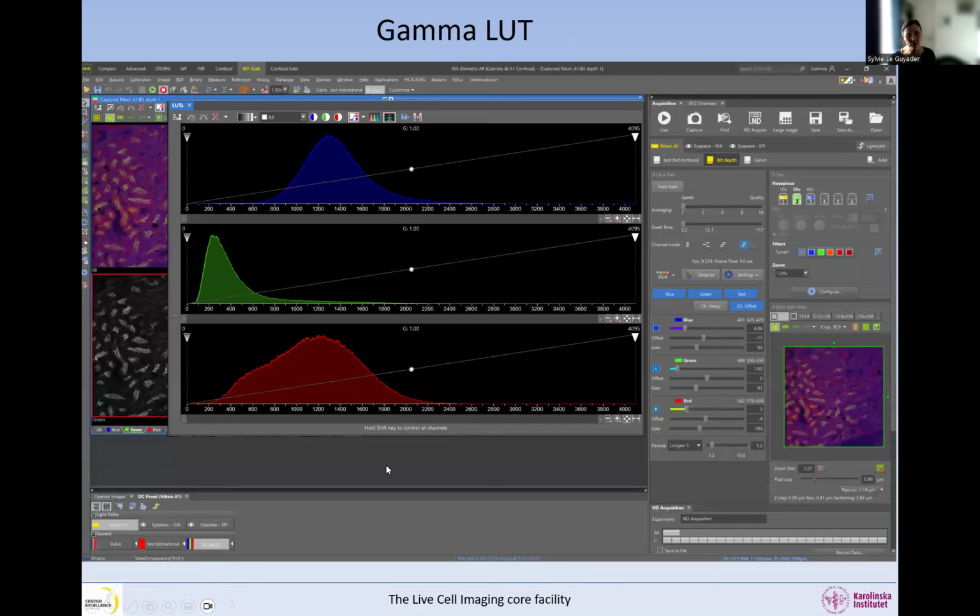So there is something else that people often do not know, and it's called the gamma. When we look at the lookup table and the histogram, what we can see is that we have a minimum and a maximum, and that corresponds to the bit depth. But we also have a number, and it's in different places in different software, but very often it is represented by a little ball that is in the middle of a line that goes between 0 and the maximum bit depth. And that ball, you can drag it either up or down along the line. So this is available again in all software.